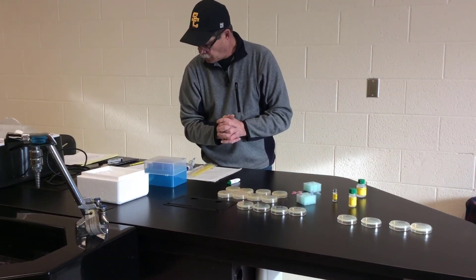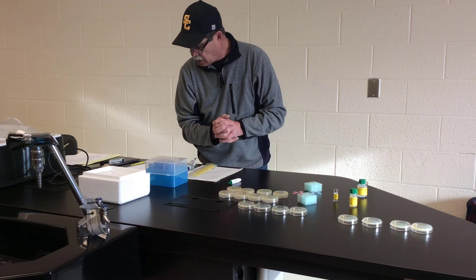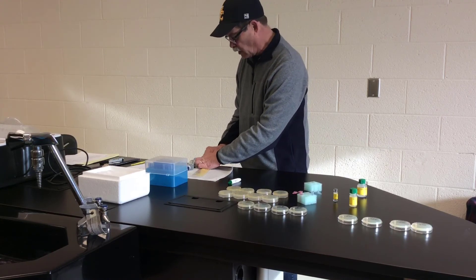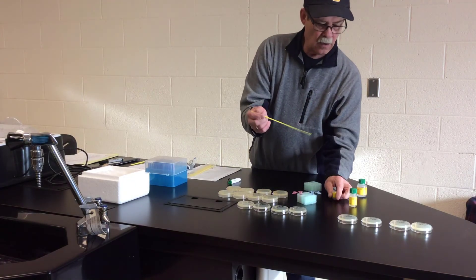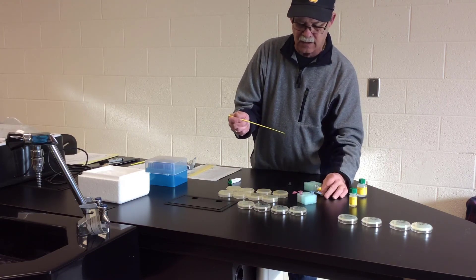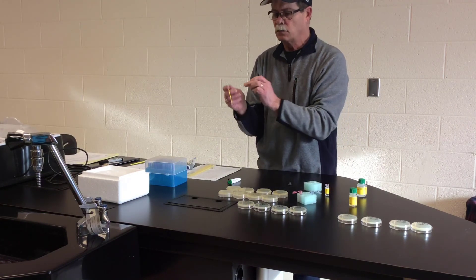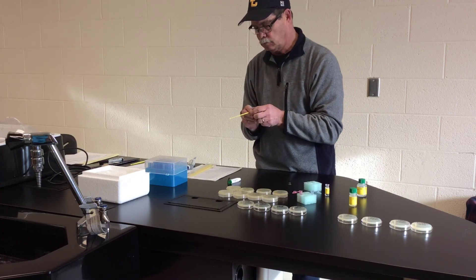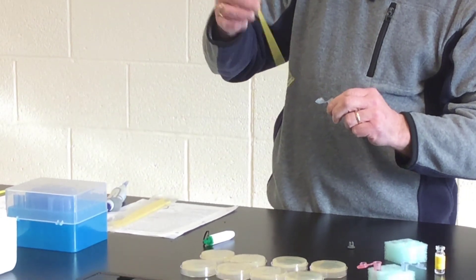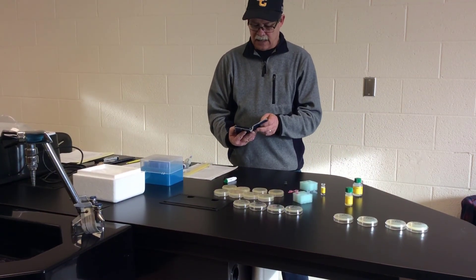We're going to incubate these tubes on ice for 10 minutes. But first, we need to add the plasmid. It's very important when getting this plasmid that you make sure you actually have something there — you can see the suspension being held. So we're going to go into the positive tube, the pGLO positive. We've now mixed the plasmid in with our isolated colony and transformation solution, and we will incubate that for 10 minutes on ice.